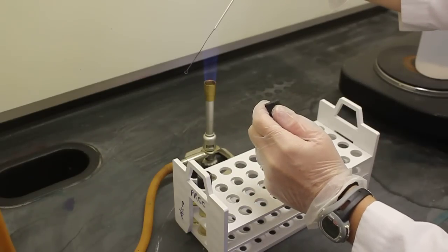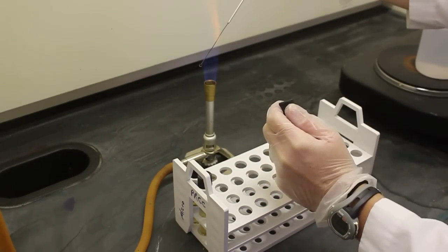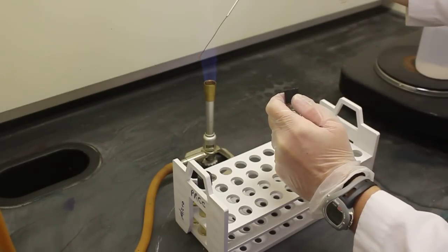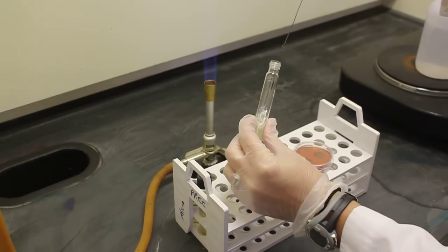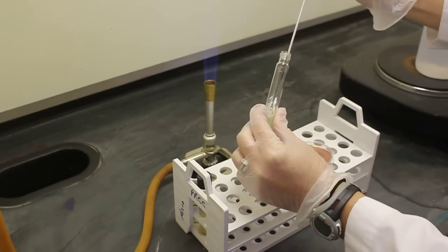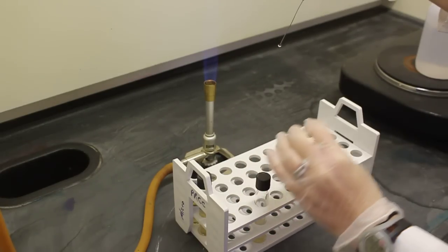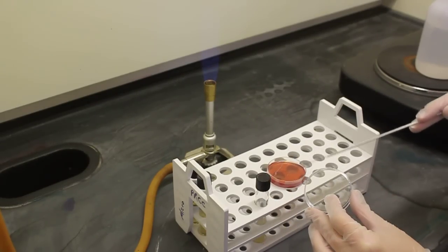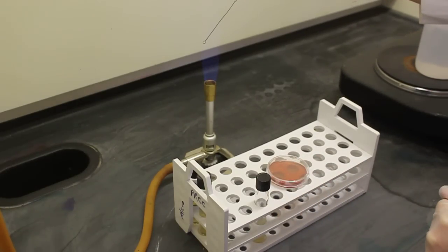Repeating the procedure, I will now inoculate my plate. To inoculate the plate, simply touch the top. In a zigzag pattern, you want to rub all over the plate. Now I am finished. I will sterilize my loop and we are finished.